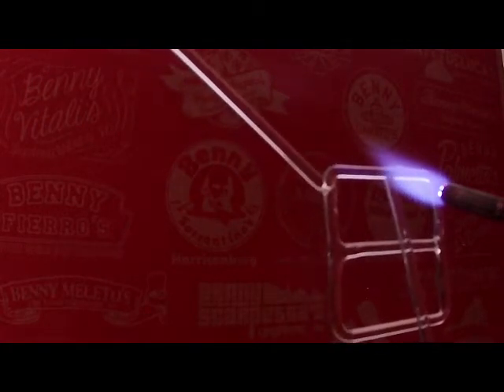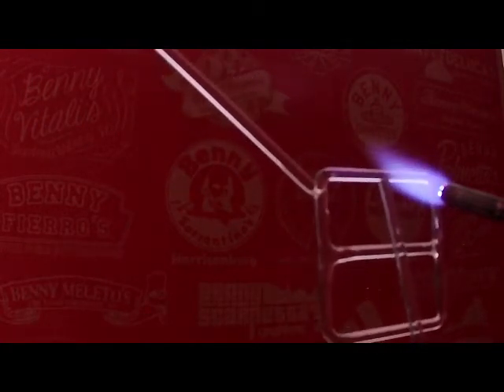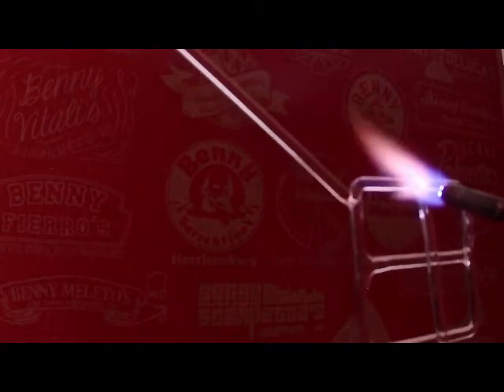So I'm eyeballing it. And I'm basically going to try and weld it right about there. So I'm seating it in, and I'm coming in here. And I don't want to push too hard. I want it to be firmly in position, but I don't want to push too hard. But at the same time, if I don't give it a little bit of a push, it can move. So I see it becomes a little bit liquid there, so I back off.